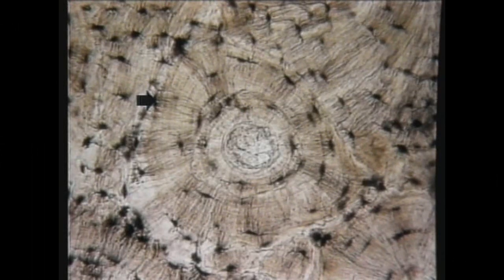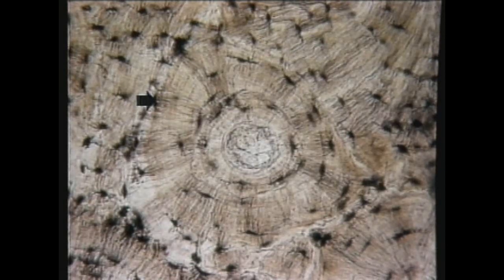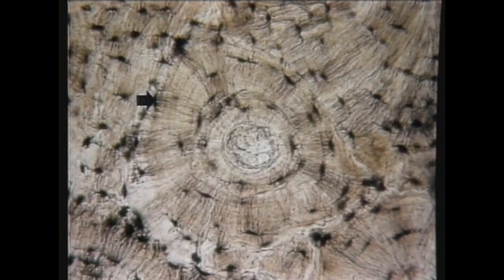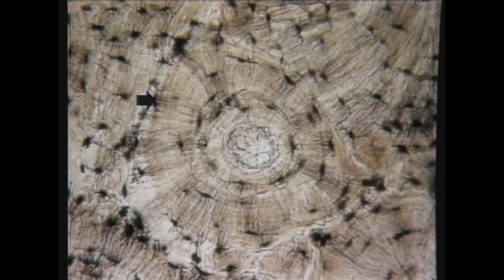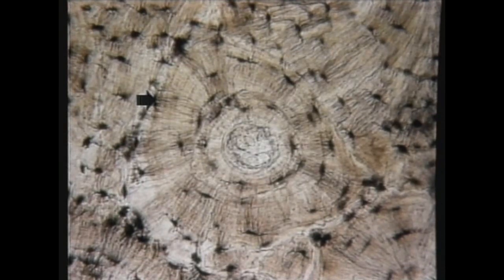Here's question number one. Name the structure that the arrow points to on this slide. If you said it is a lacuna, you're right. The arrow points to a lacuna, which is the space occupied by an osteocyte.